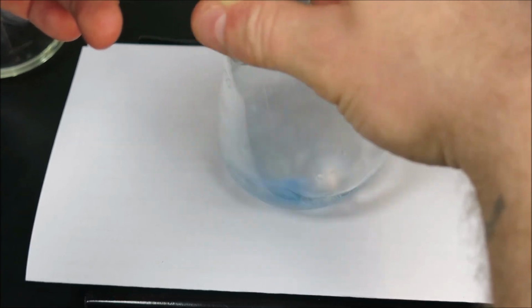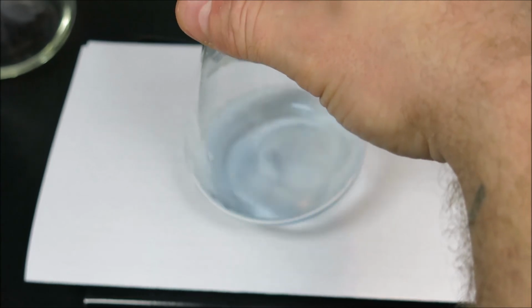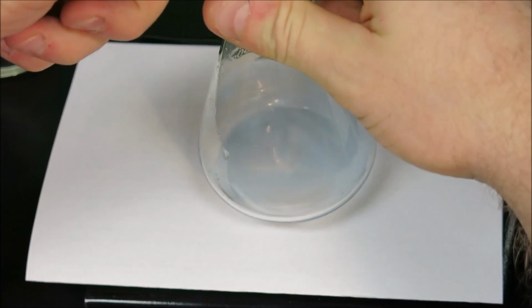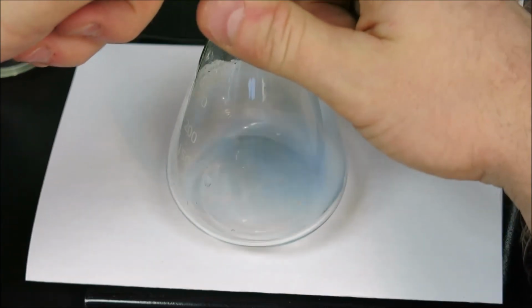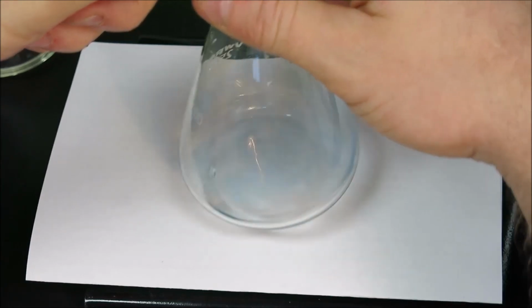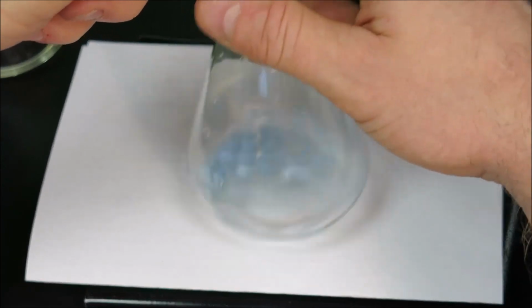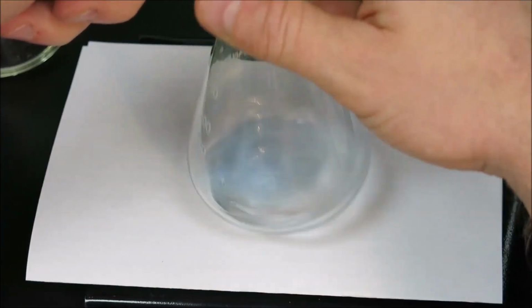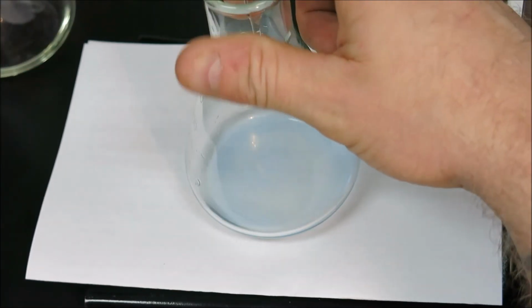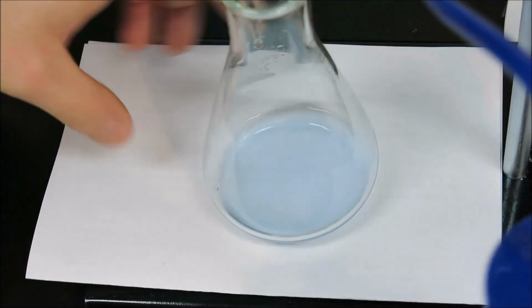So we're getting up to the 5 milliliter mark, and our color is still blue. Now at this point we'll slow it down and add just a drop at a time, attempting to reach that perfect endpoint of green. While it may be slow to reach endpoint with only one drop, the idea in titration is to have a single drop change the entire color, which indicates the exact volume that has reached molar equivalency.